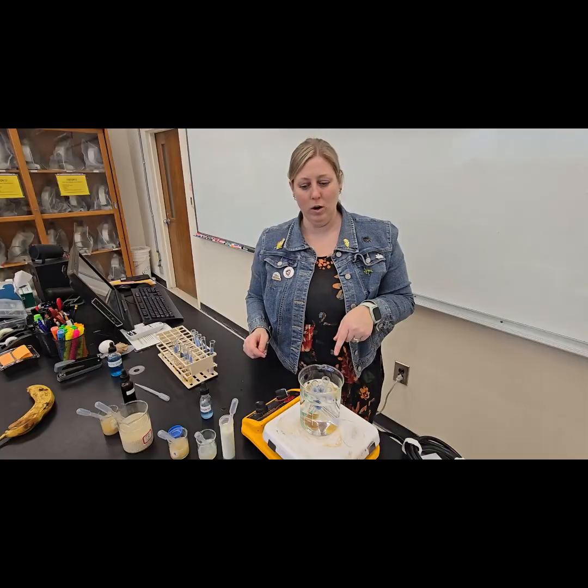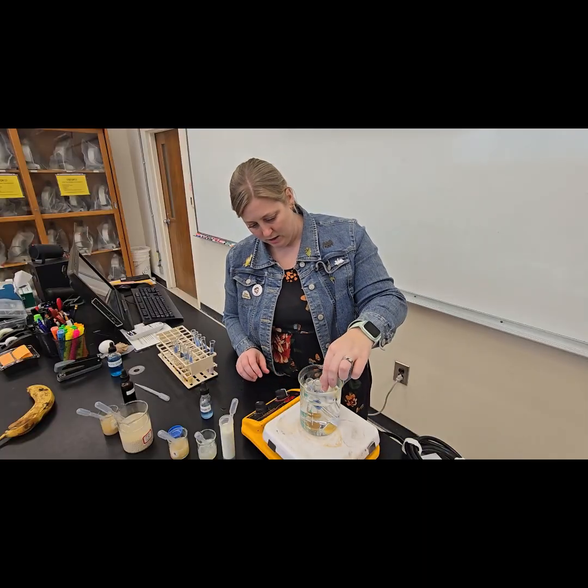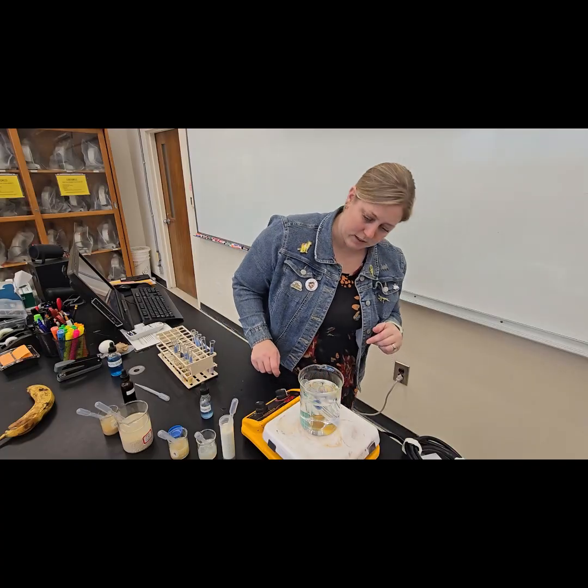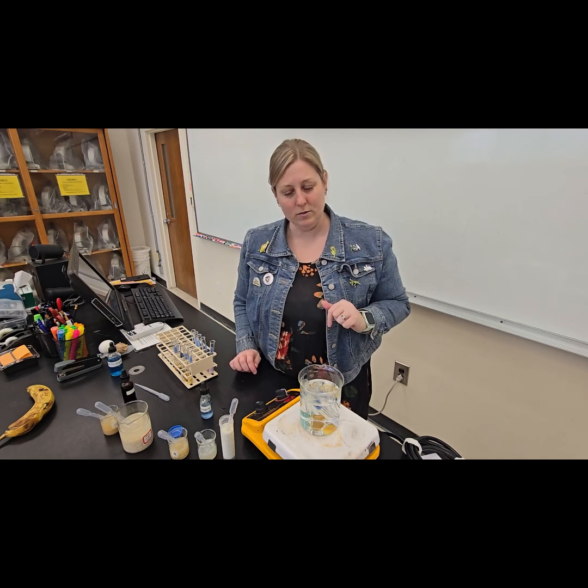And we're gonna let this water run a little bit longer because it is currently not really giving good results. Sometimes it can take 5 to 10 minutes. So come back and I will get those results for you.